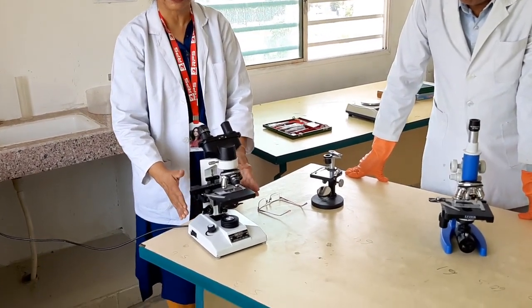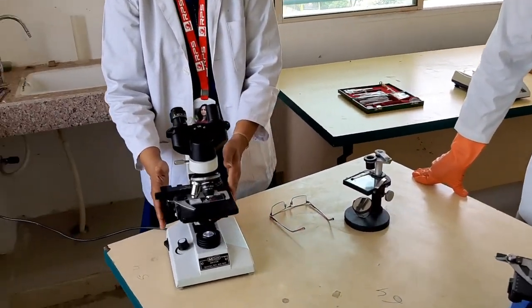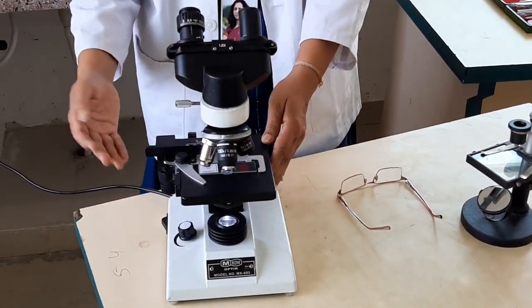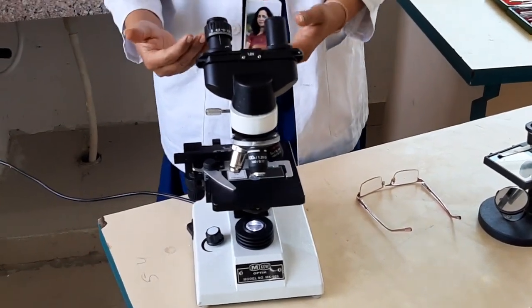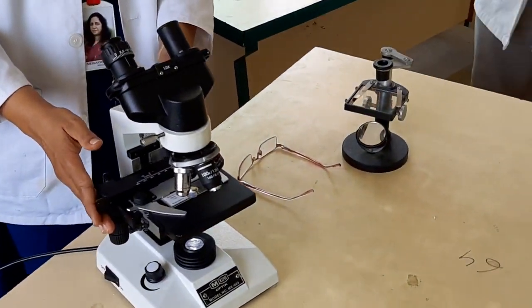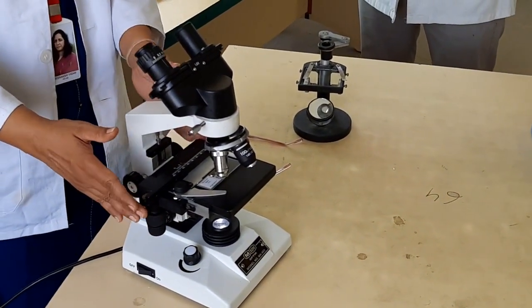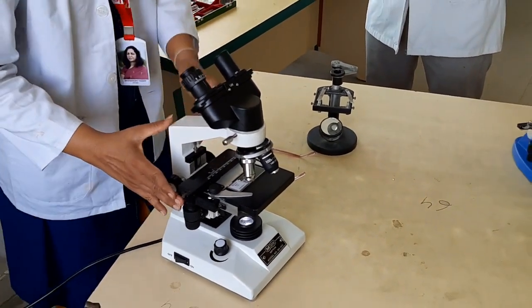This binocular microscope is usually not used in schools — it is used in colleges for M.Sc. studies. However, our school has it to give students greater exposure to how we can see through a binocular microscope, as it is typically not available in senior secondary schools.